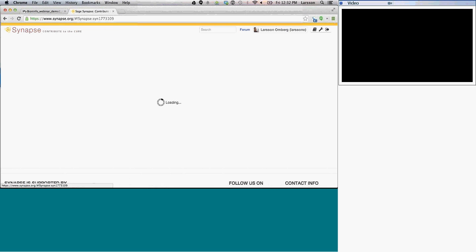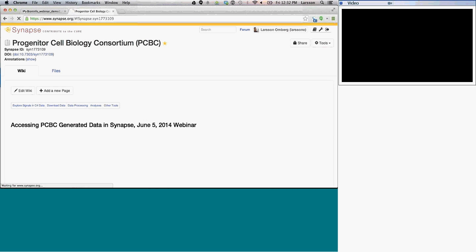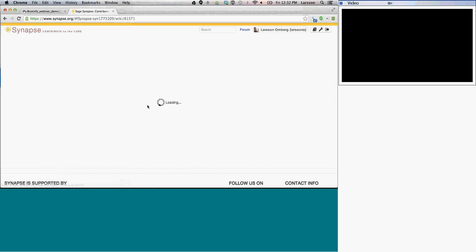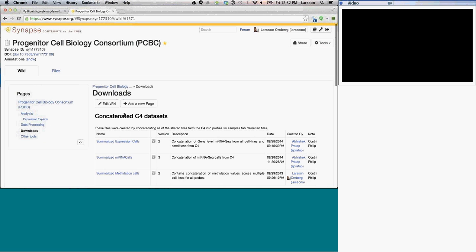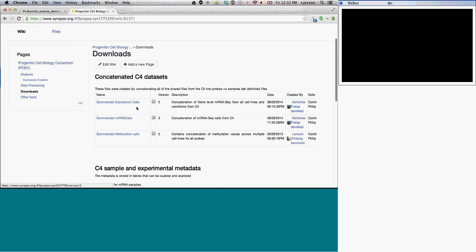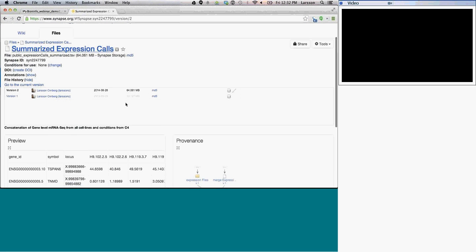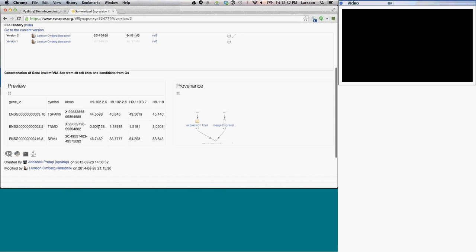So we'll go to Progenitor Cell Biology Consortium, and we'll go into the files. Actually, we can go here into Download Data. And the file that we're actually looking for is this summarized expression call right here. So what we downloaded is this data set right here.